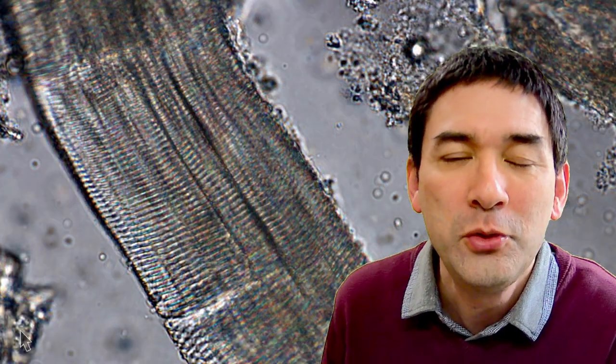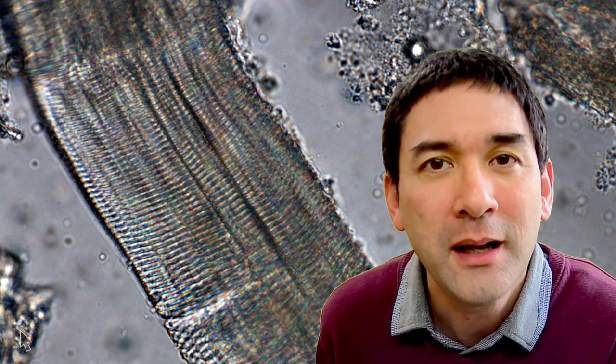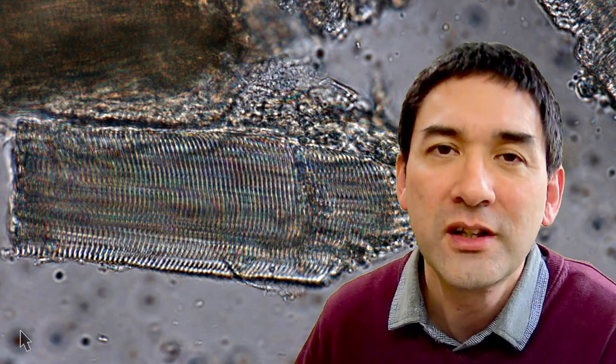What is so fascinating is that even back in the early days — the 1700s and 1800s — even though their microscopes were so much simpler, scientists were still able to make very important discoveries. If you have a microscope at home, you can also try this and test your own microscope. You need a magnification of at least 400 times to be able to see those light and dark bands, those little striations. If your microscope has a condenser, make sure you close it all the way. I also increased the contrast a little in this video, because those bands can be difficult to see. Make sure the muscle fibers you look at are completely separated from each other — if several cells are stacked on top of each other, it's very difficult to see the striations.